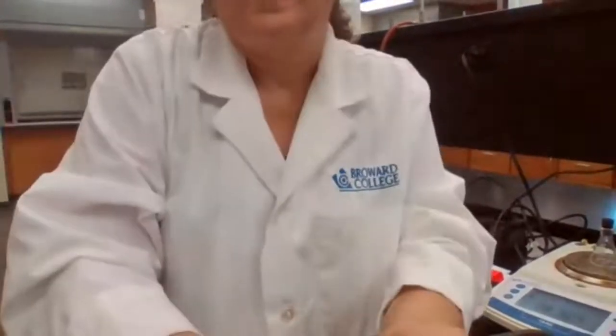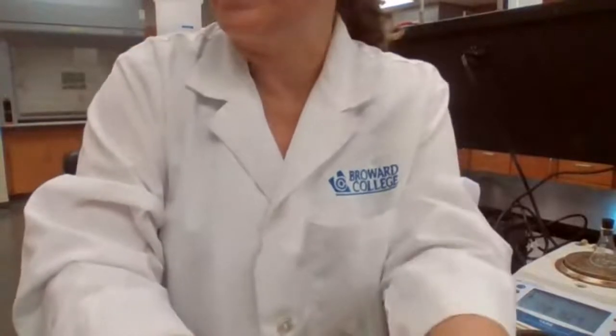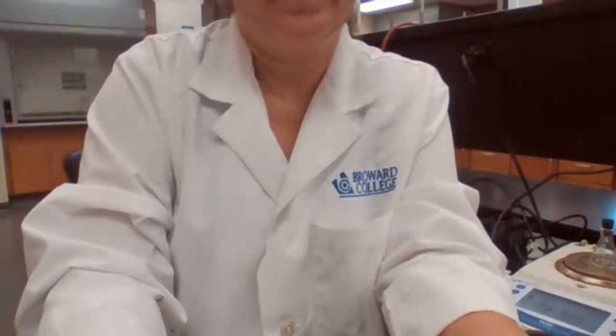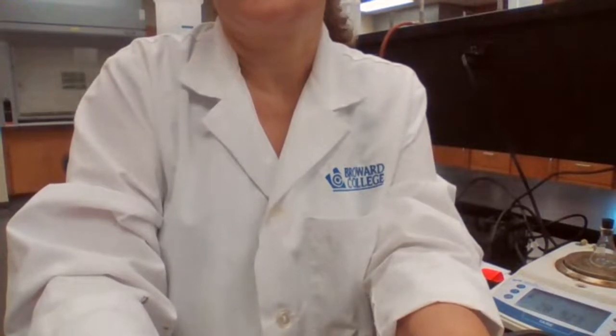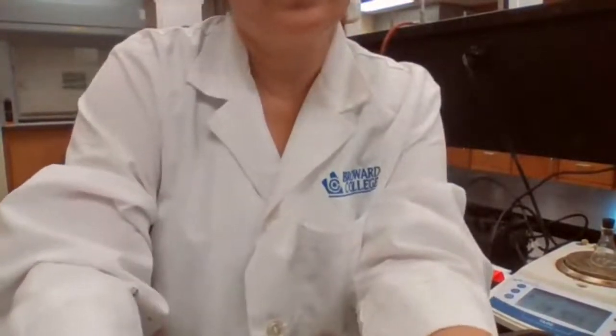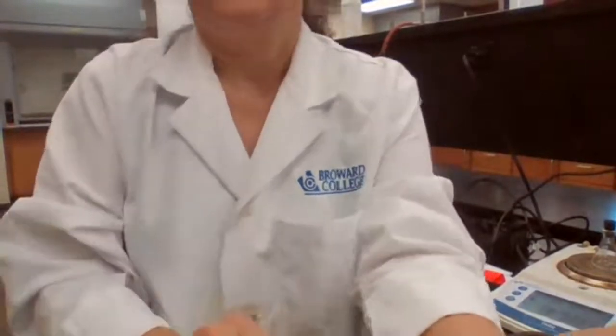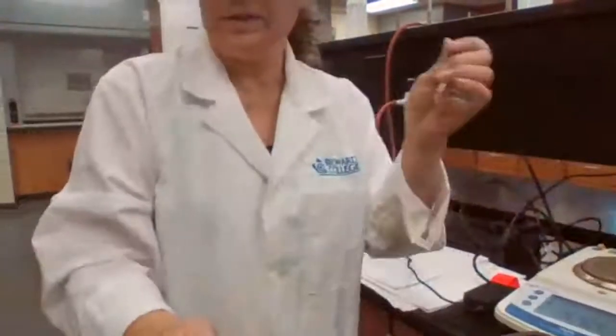You're going to take a new sample, a different flask, to measure the mass. This time, the mass equals, this is for the second trial, unknown A. Mass of the stopper is 28.925 grams, plus the liquid. Going to get the 10 milliliter of the liquid again.